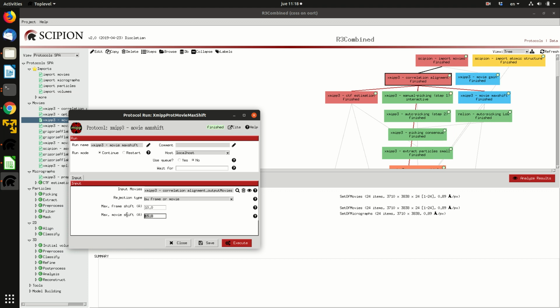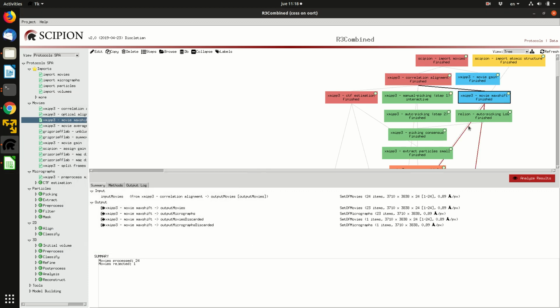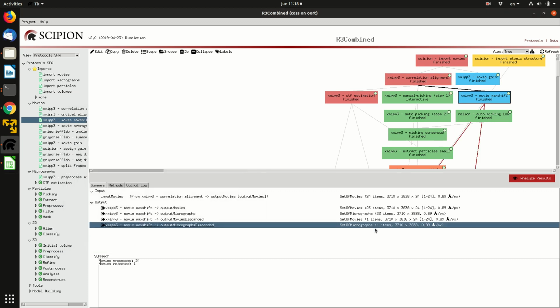The other one is this one, that is more sensible. That is, if the whole movie is moving more than 15 angstroms in total, then that has moved too much, and I don't want to keep that movie. Again, this is never truly deleted. It is only put aside so that you can inspect these micrographs and take a decision on what to do with those.